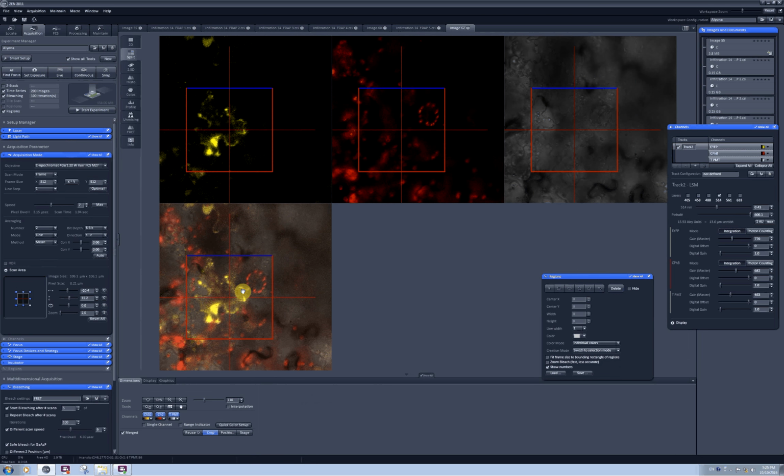So please make sure when you make FRAP or FRET assay and you want to crop your image, you need to make sure manually that the pixel dwelling time is set on the value which you optimized for your sample.